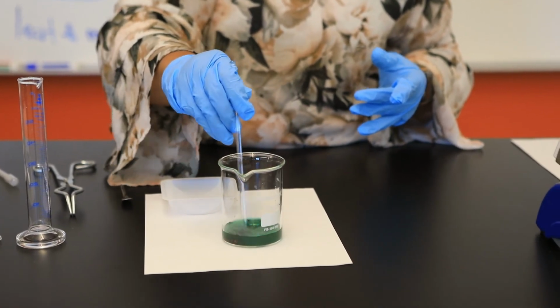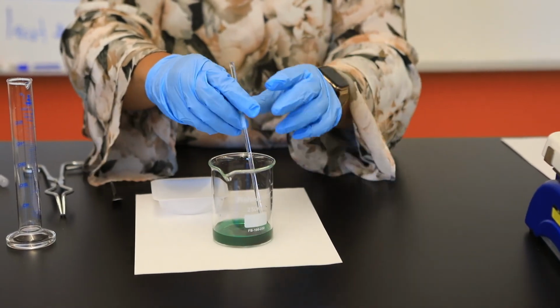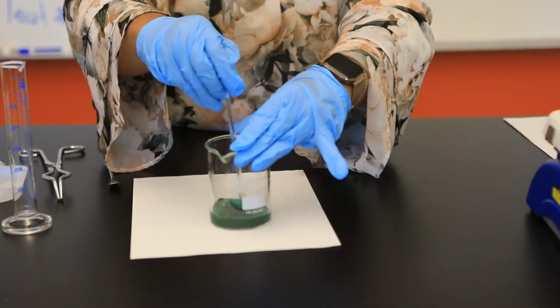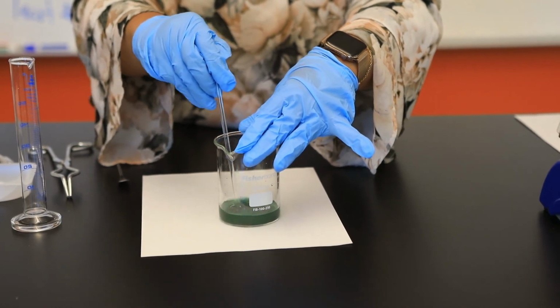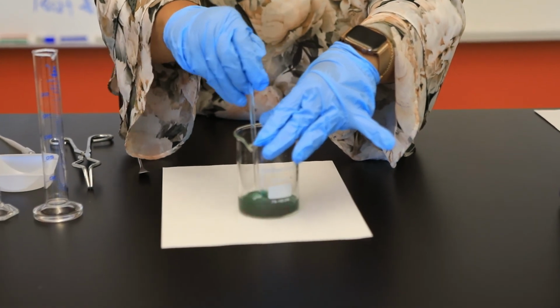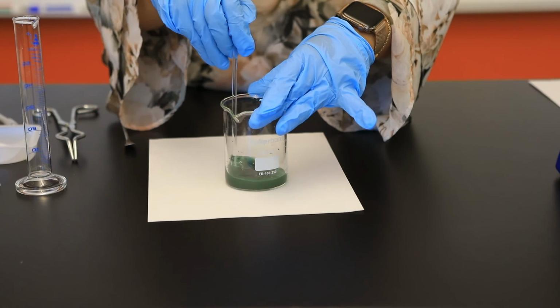And to make sure that this reaction is complete, I'm going to be adding a few drops of HCl. So I'm going to keep on stirring. As this reaction goes, you agree that my zinc is going to be reacting. So the amount of zinc at the end hopefully will decrease. And at the same time, we will produce our copper metal.